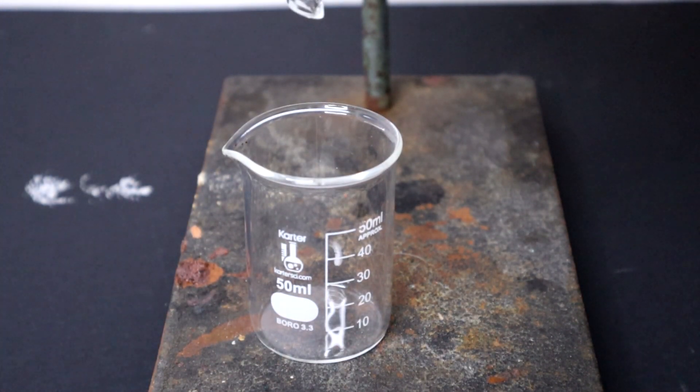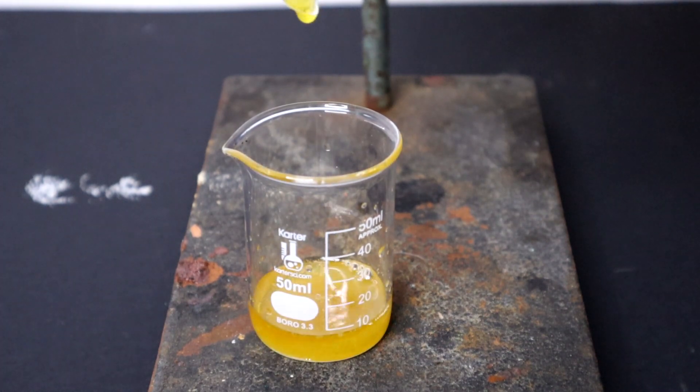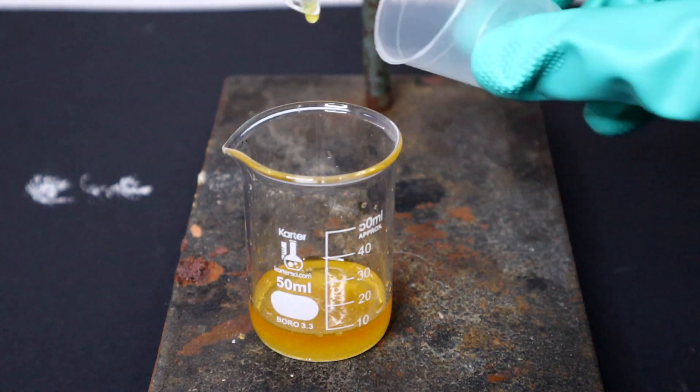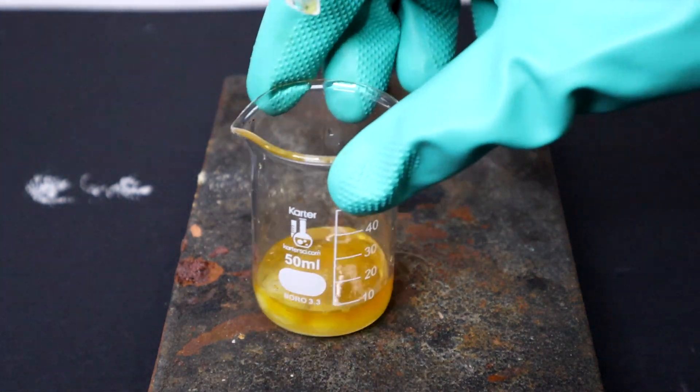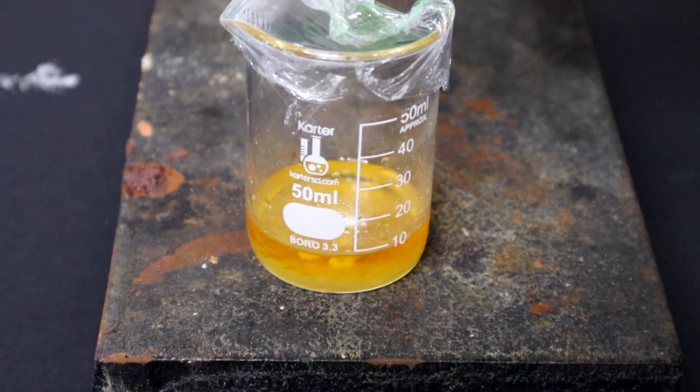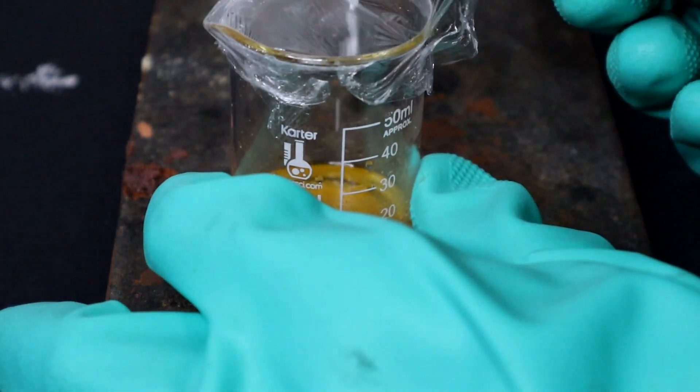In the end, the yellow liquid was drained into a 50ml beaker along with 3g of potassium hydroxide. I'm using the potassium hydroxide as a dehydrating agent. Because the solution still looked wet, I added another 2g of potassium hydroxide, for in total of 5g.